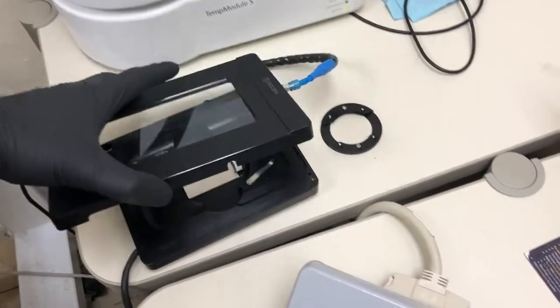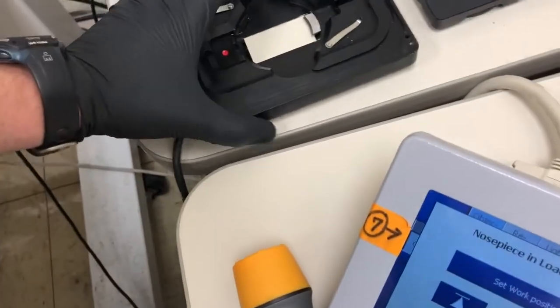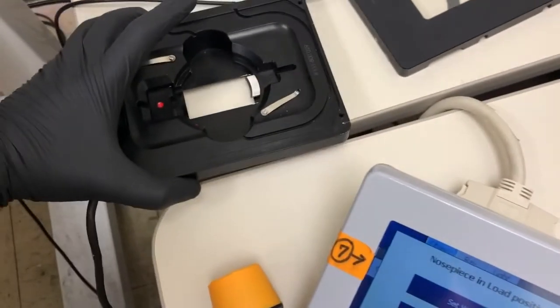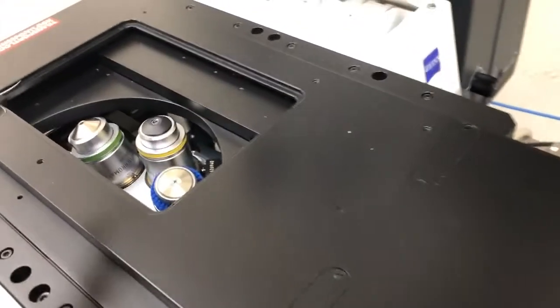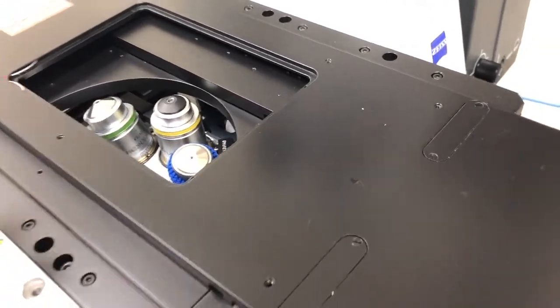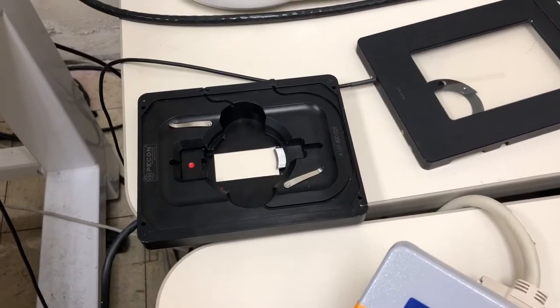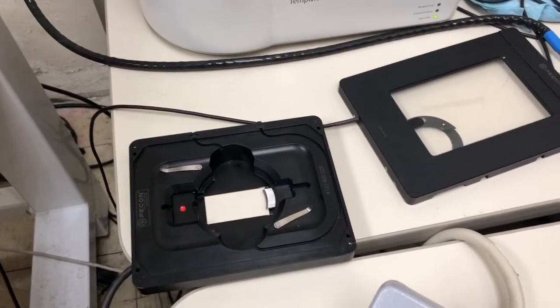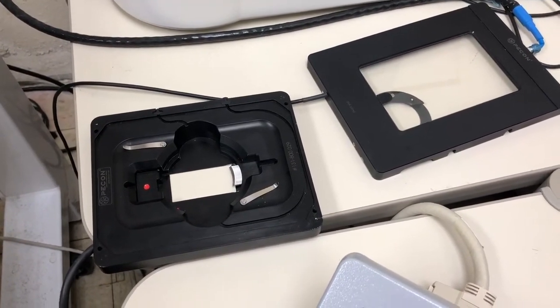So the lid is one component. The other part of this is this. This is kind of a heavy block of metal that will be inserted in here, okay? So this is why we went to the 10x objective, to avoid bumping this thing into something very expensive and fragile. All right, so I'm going to situate the camera in a way that you can see a little bit better when I mount it, and I'll show you how to get that done.